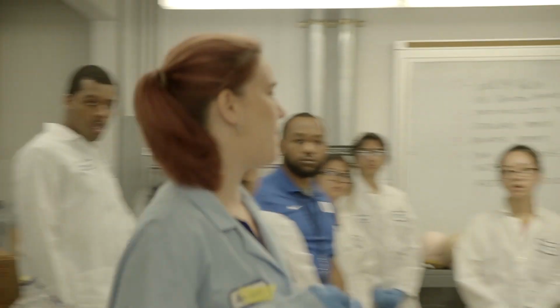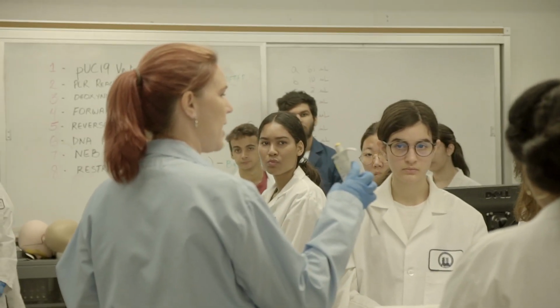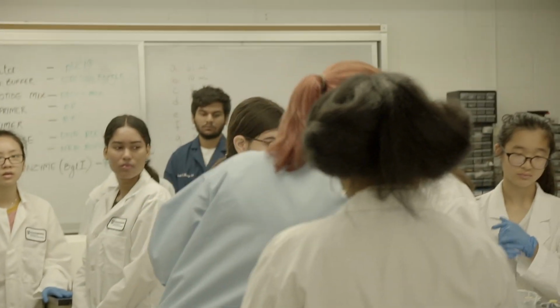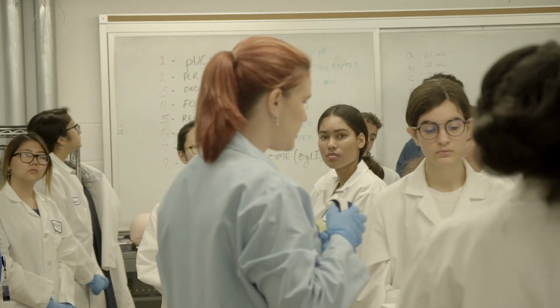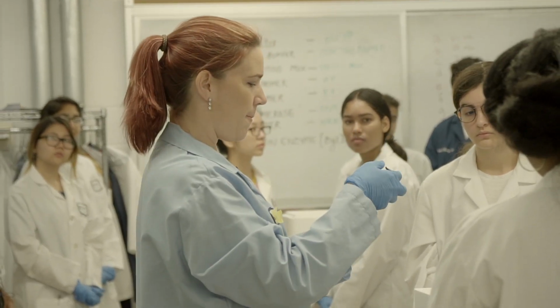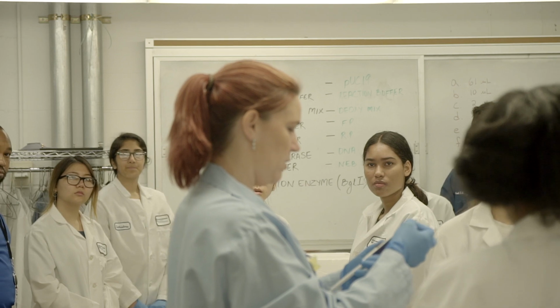Some of you saw this last time, but these are really, really small volumes we're going to be pipetting. So, how do I know what range my pipette will work at? It's on there, right? The reason why we had a multiplier on all these reactions is that the minimum you'll draw up is 2 microliters. But that's a tiny, tiny drop, if you haven't drawn up that small drop before.